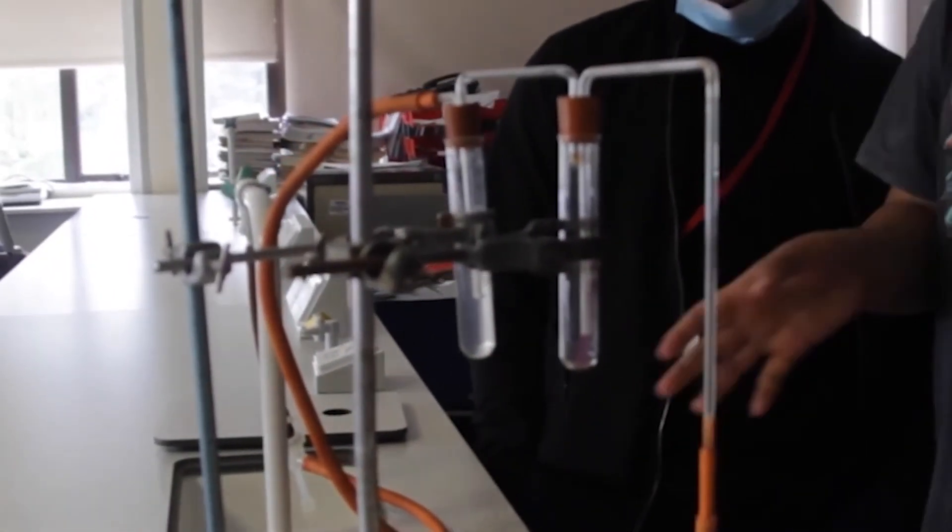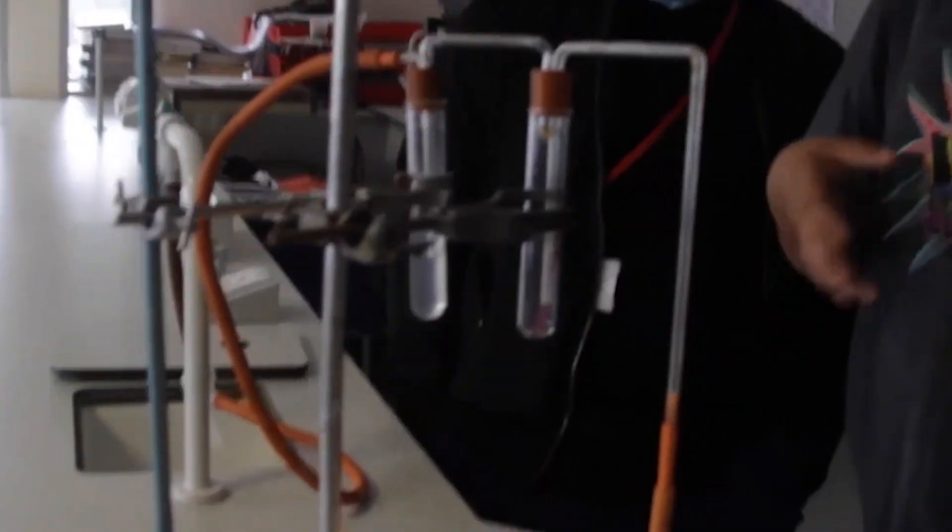And that is how you investigate products of combustion. These are the two products.